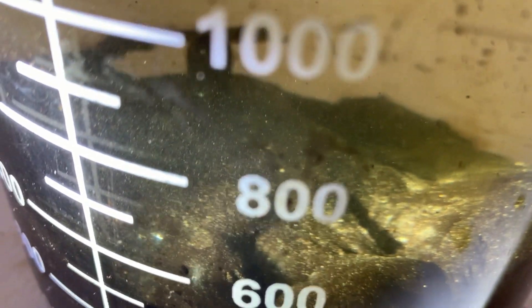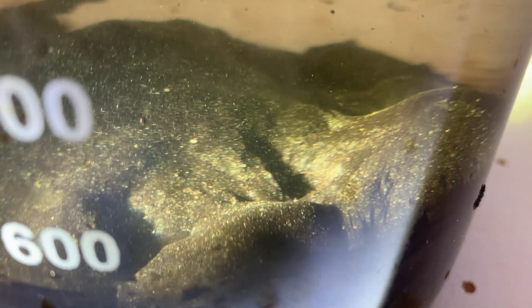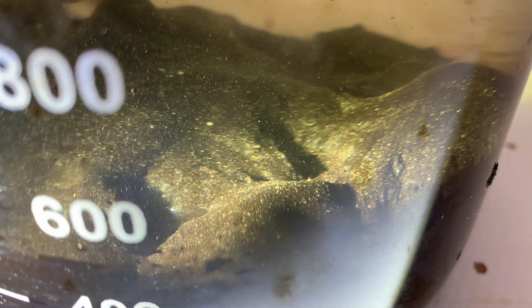And this is how the sand phase looks after two hours of leaving it alone. Finally, we have a total separation — we have the hydrocarbons all on top and the clean sand at the bottom.